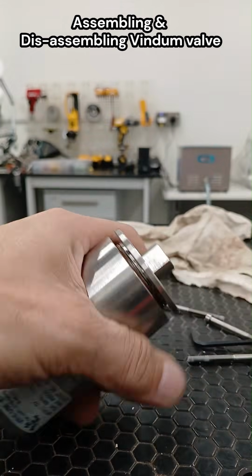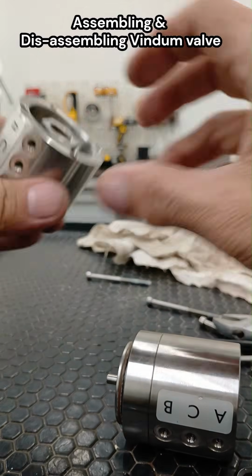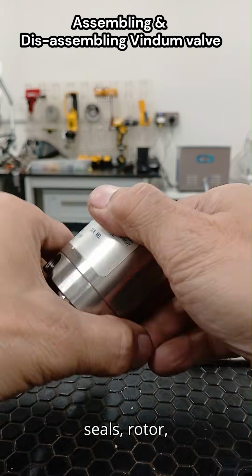Typical repair steps. One, preparation. Shut down and depressurize the system. Disconnect all tubing and mark port positions. Have the correct repair kit: O-rings, seals, rotor, lubricant.